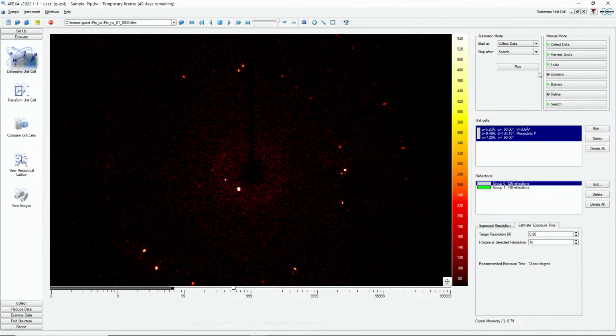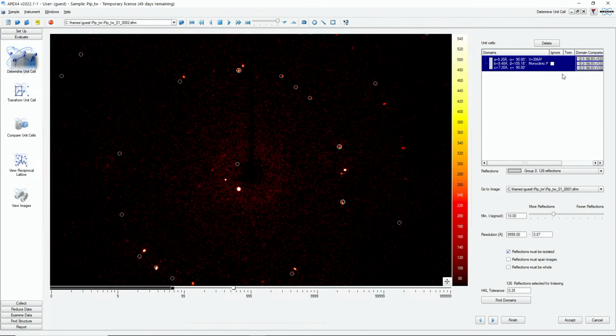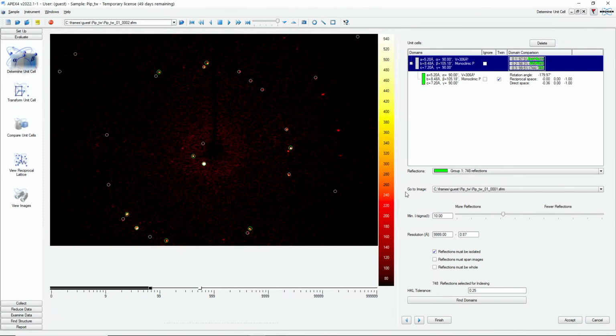What we can do now is use this domain functionality, because we know we have at least a second domain. And by definition, in a twin the unit cells need to be the same. Their orientation is just different. So what I will tell the software now is use this unit cell or matrix, and look in the green reflections and find more domains. The green reflections were all of the reflections that were left over. And so it found one additional domain.